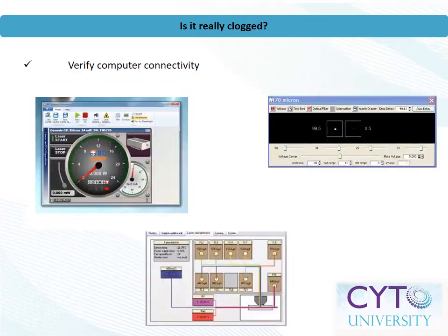Verify that all lasers are on and that the delays are accurate. For open systems, this can be checked visually. Always remember to follow proper laser safety procedures. On other systems, there may be software-based indicators, such as the two examples shown here. For multi-laser systems, consider triggering off of other lasers besides the primary laser in order to determine functionality.